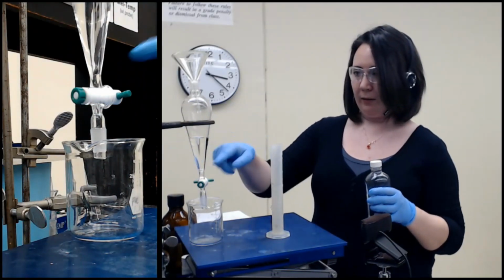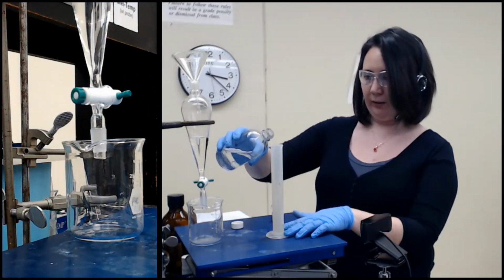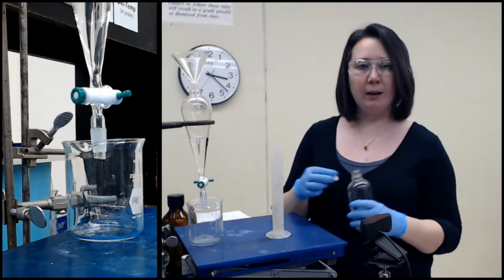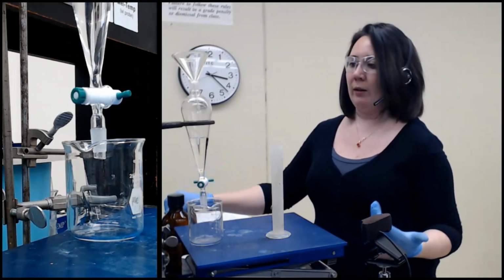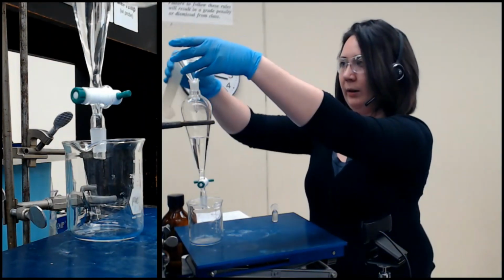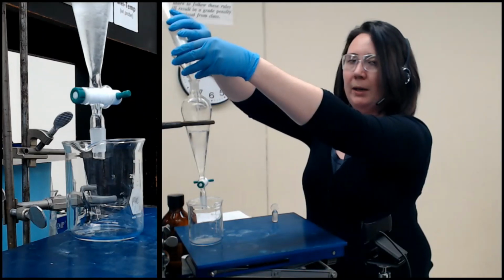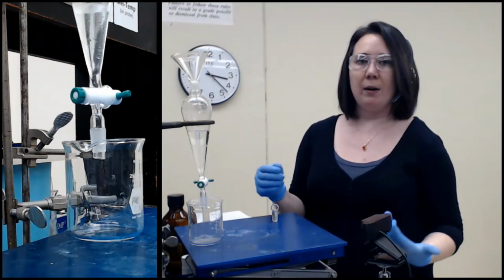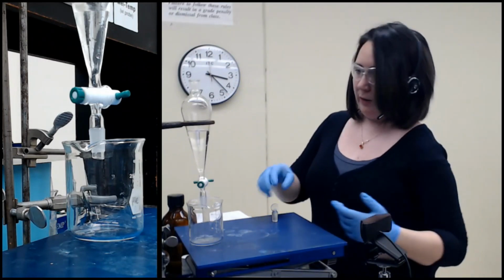So I'd used about 30 milliliters there. I'm going to use about 15 for the first round. We're going to do this twice. If you remember with extraction theory, it's more efficient to do smaller volumes multiple times than one large volume. It has to do with that extraction coefficient. The amount that can be extracted in a given step is dependent on that extraction coefficient, and you can't go above that maximum. So doing it multiple times just lets you get more efficient.